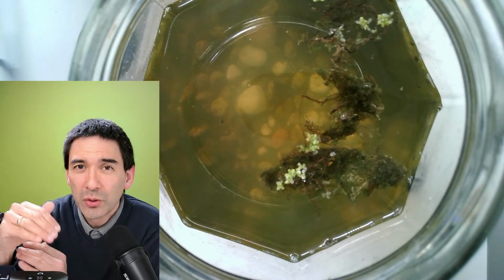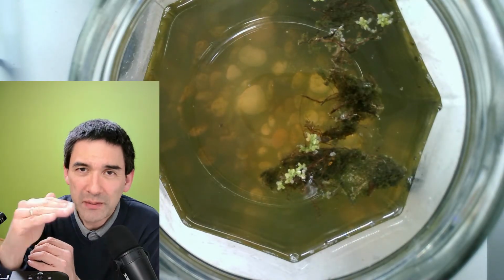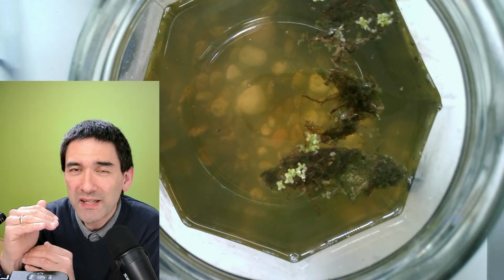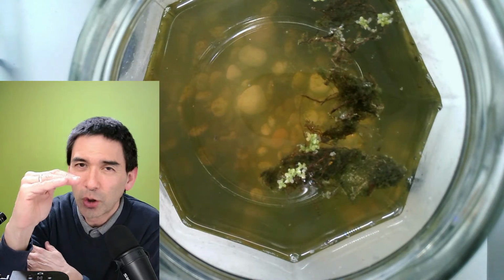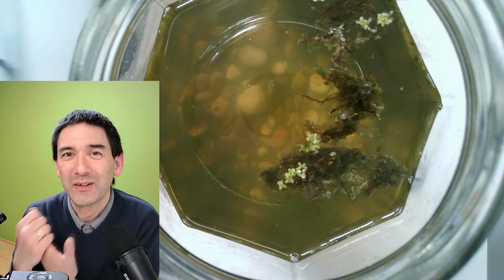Right, so sometimes those scanning systems have some kind of autofocus mechanism, but especially for slightly thicker specimens, you probably want to focus around a little bit and look at what's more on the top or on the bottom. But this does not. I've not, at least, seen any application yet that allows you to do that.